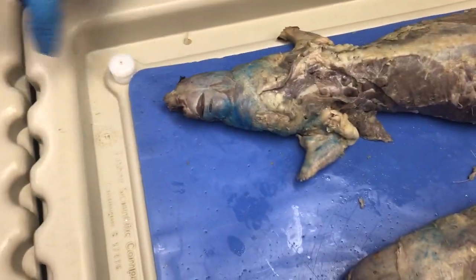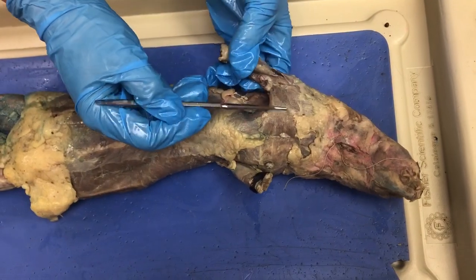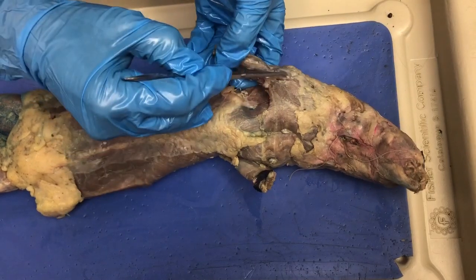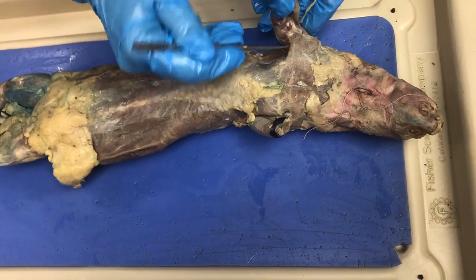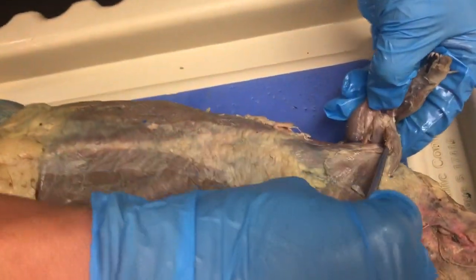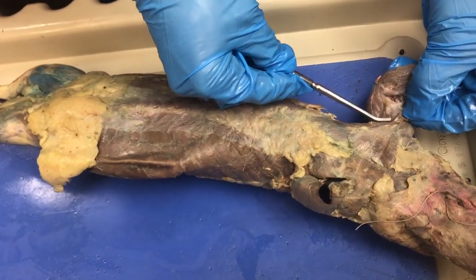We have a couple of muscles on the arm that we didn't go over. We had talked about the pectoralis major. So this one right here is the brachialis. Deeper to that is where the biceps brachii is, but we would need to transect it. That's where the biceps brachii is — as you can see, this one's not exposed right now. But that's the biceps brachii.